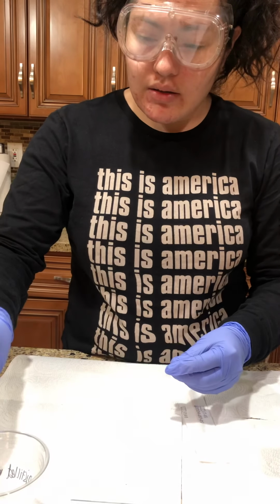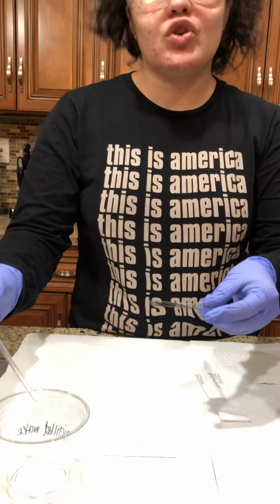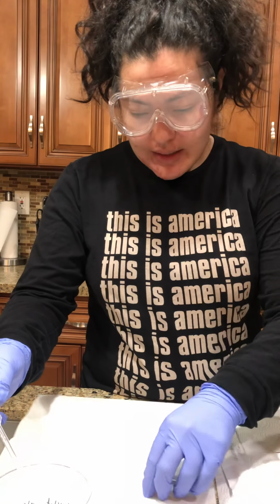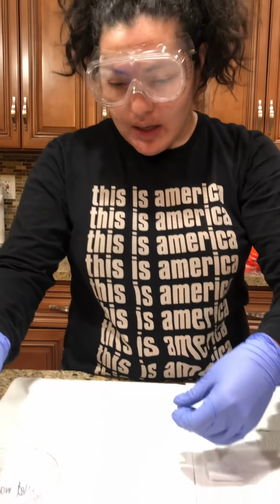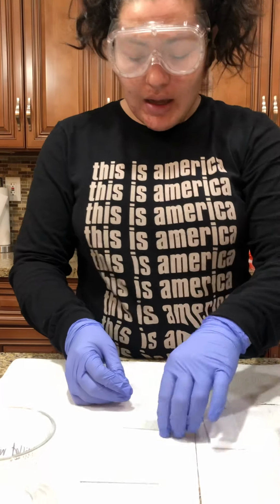I'll get distilled water and put 1 drop on top of that specimen from my cheek, and then get the cover slide and place it on top carefully, okay? As soon as I do that, I'll take it to the microscope and evaluate what I'm seeing, okay?